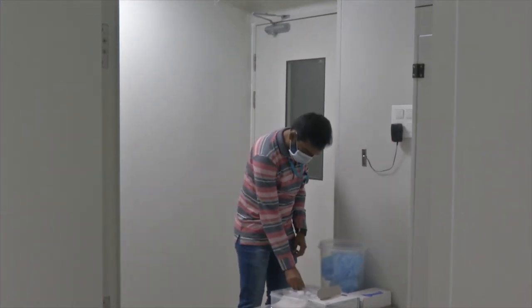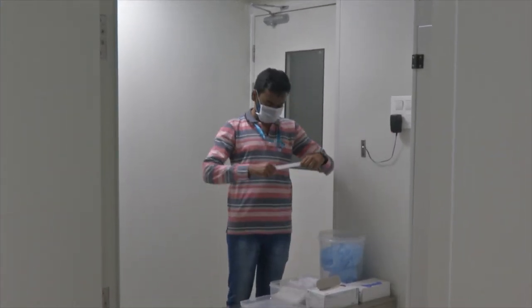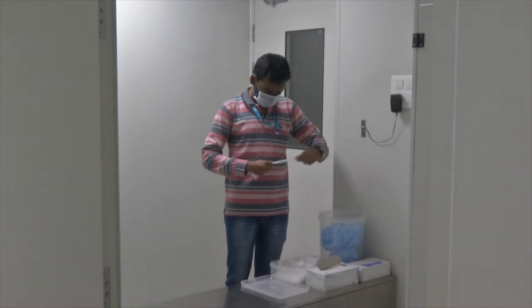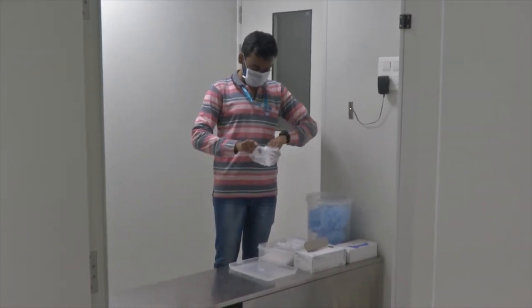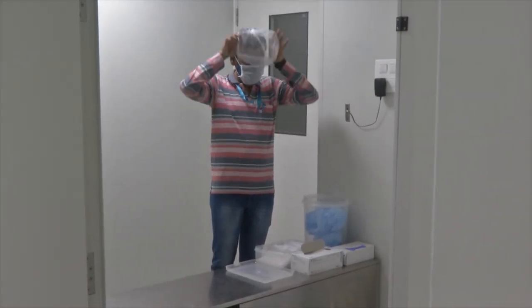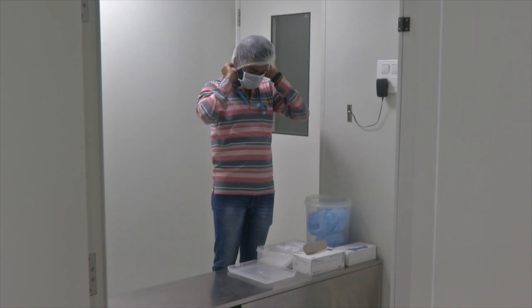The next step is to wear a hair net. A hair net is used to prevent any kind of particle or hair from falling onto a device or on the clean room floor.